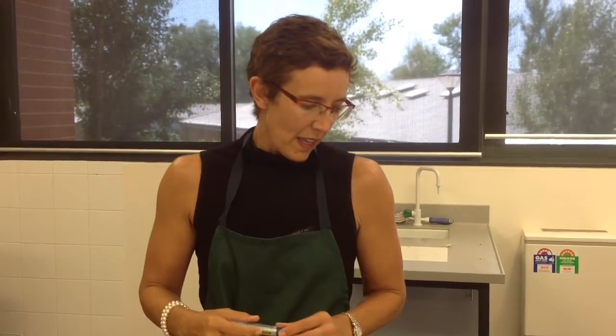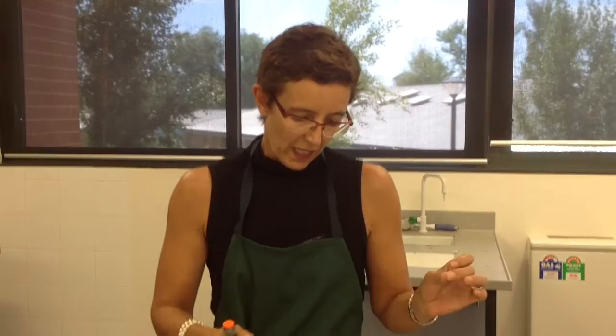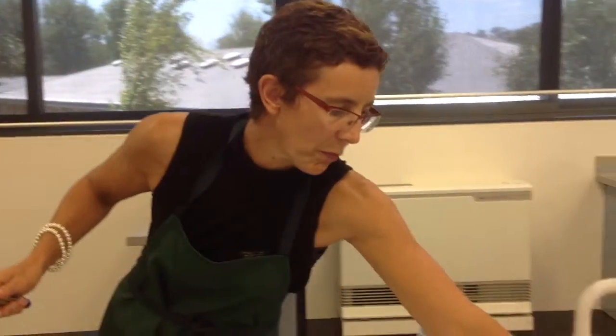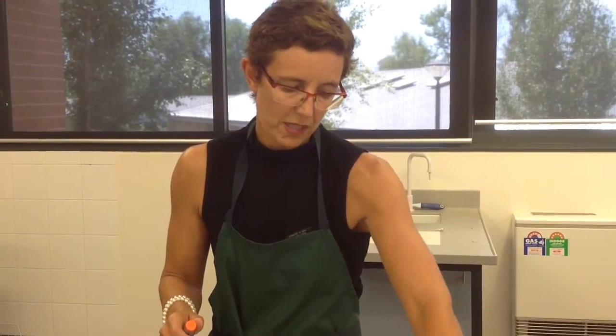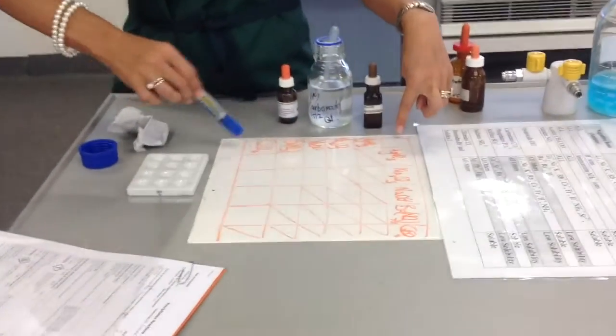This is the preparation for the precipitation reactions. Now, a precipitation reaction occurs when you have two solutions and you react the solutions and you get a precipitate, or a solid, formed. So what we're doing, as per Prac 5.2.2 in the Year 10 book, is we've looked at the solutions that we want to add, and I've drawn up a grid on the white tile here.